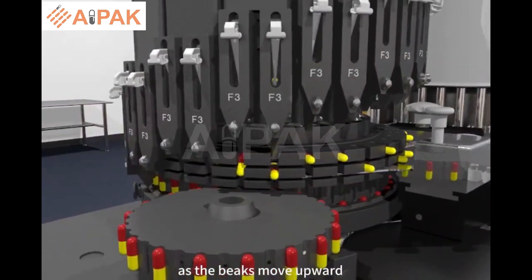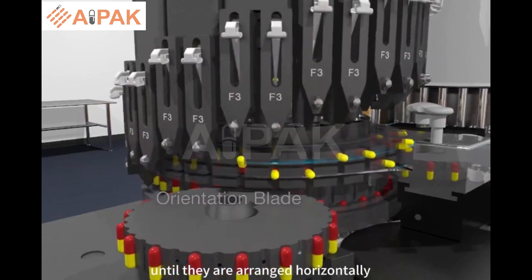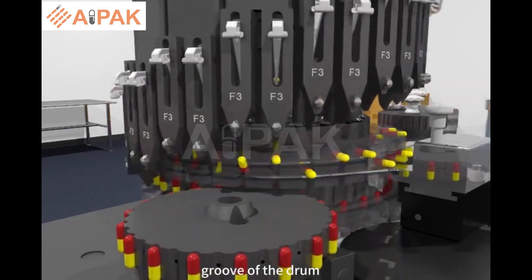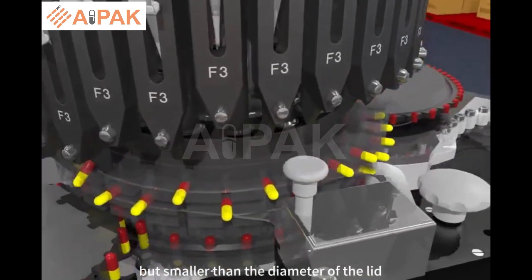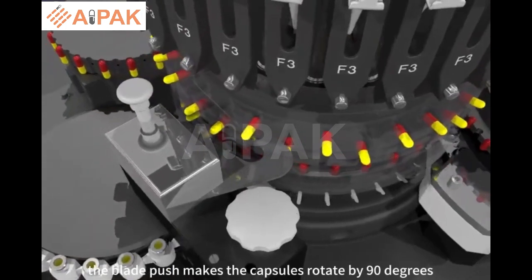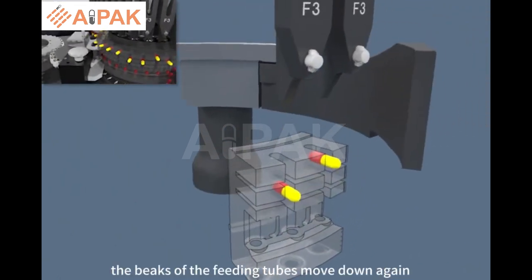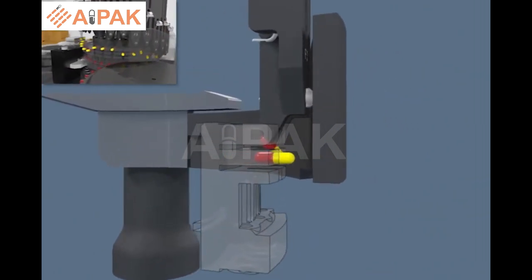As the beaks move upward, the orientation blade pushes each capsule body outward until they are arranged horizontally. The capsule orientation occurs because the internal width of the gauged groove of the drum is larger than the diameter of the body, but smaller than the diameter of the lid. Therefore, the blade push makes the capsules rotate by 90 degrees and orients only its body outward, pivoting upon its lid. The beaks of the feeding tubes move down again, completing the orientation of the capsules with their bodies downward.